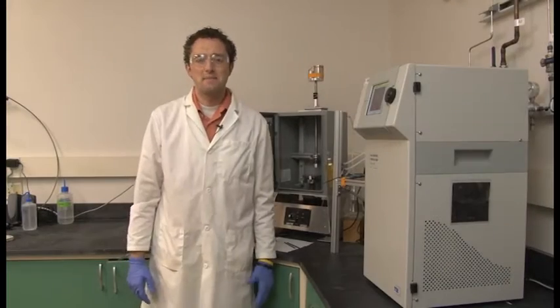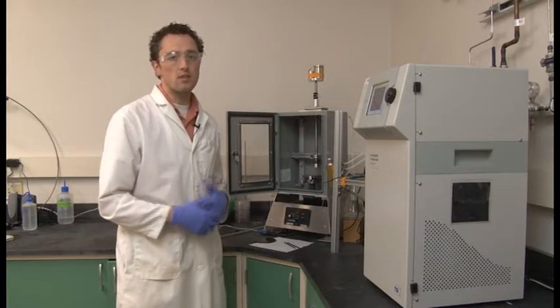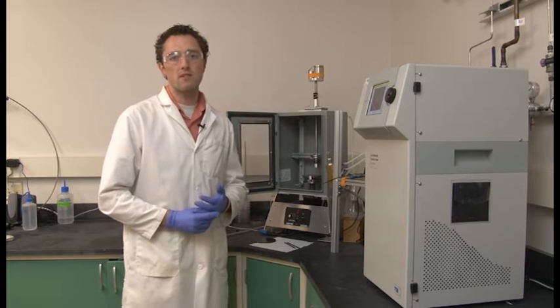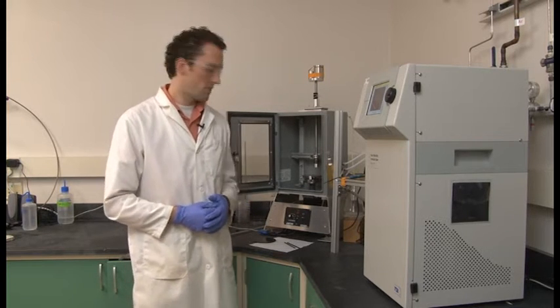Okay. My name is Dr. Jonathan Brame. I am a research environmental engineer in the chemistry branch of the environmental lab. I'm going to show you today an abrasion chamber that we use to study the release of nanomaterials as part of the environmental lab's nanotechnology focus area.